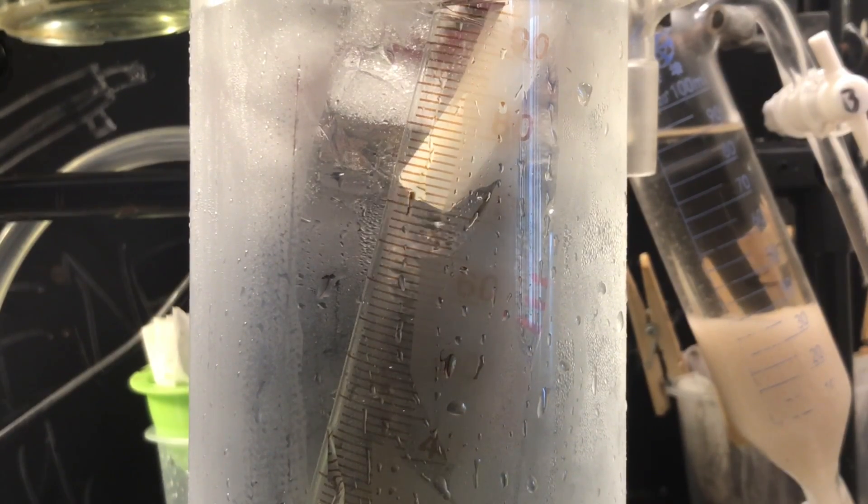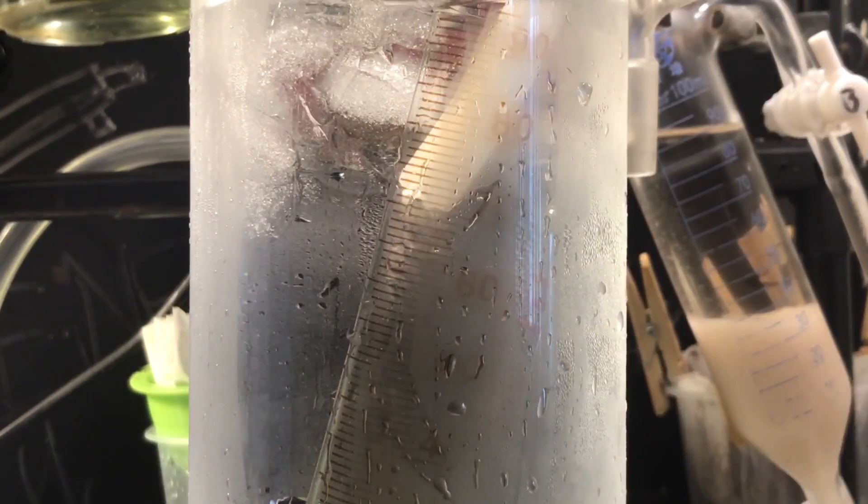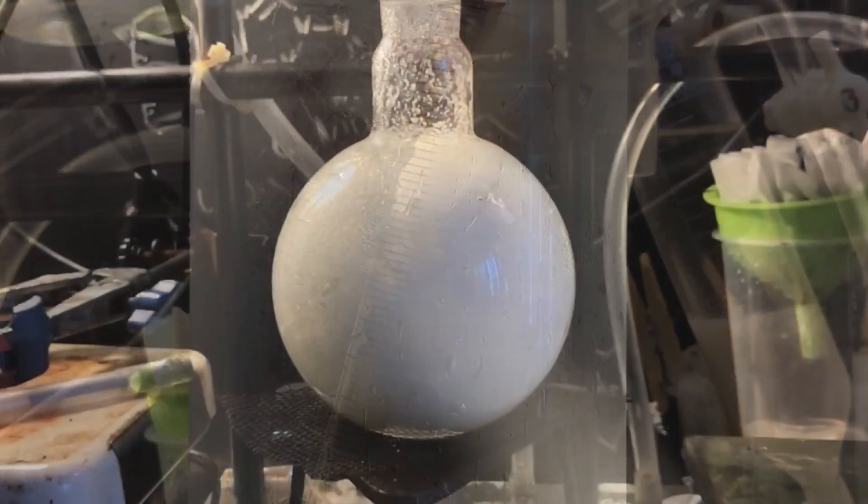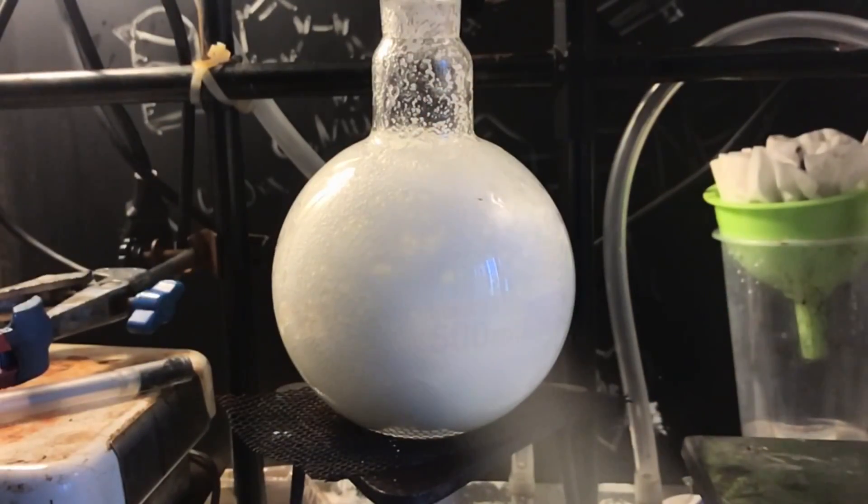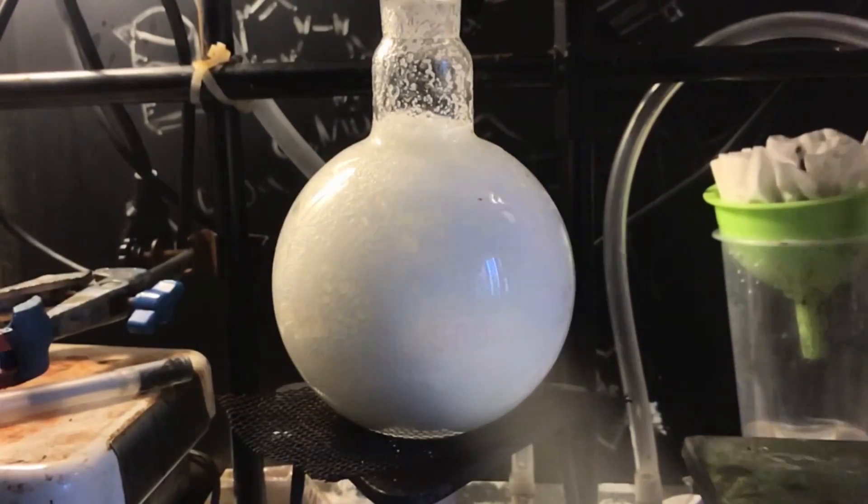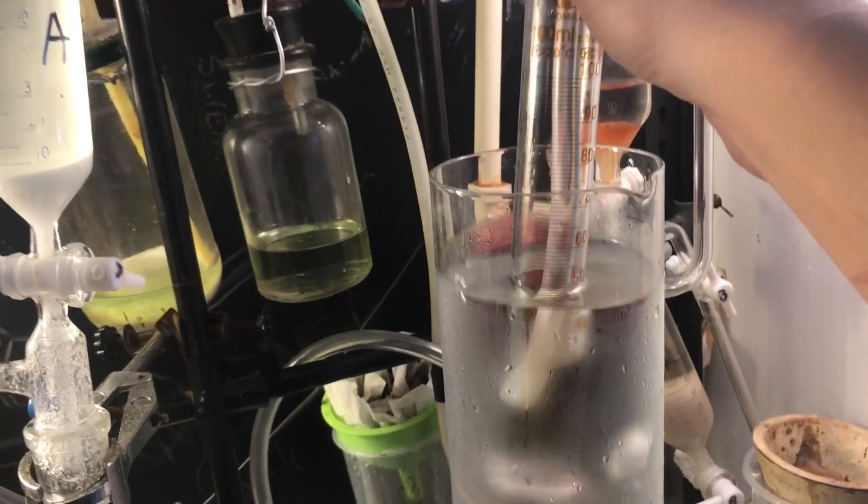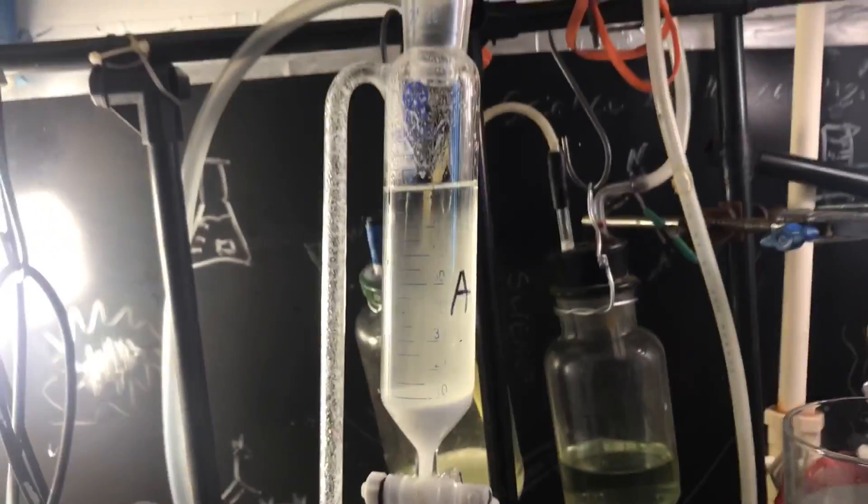You can see the gas just dissolving away, so that's a good sign. When it starts to run dry, it really starts to foam up, so that's an issue. I apologize if my voice is sort of raspy, don't know why, but probably not COVID. You can see a suck back happened, because the flame went out for a second.